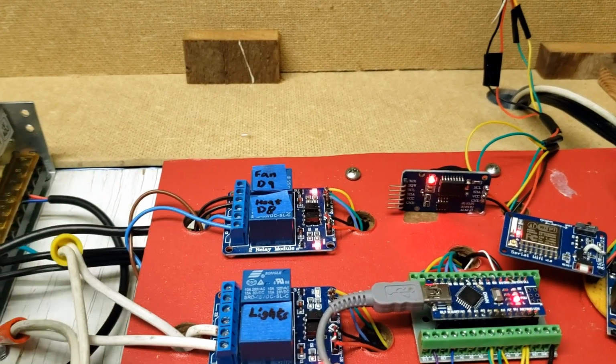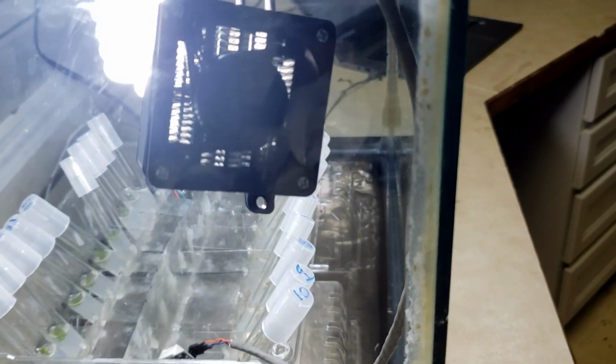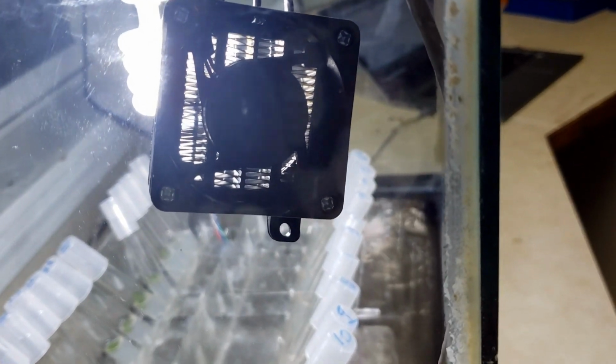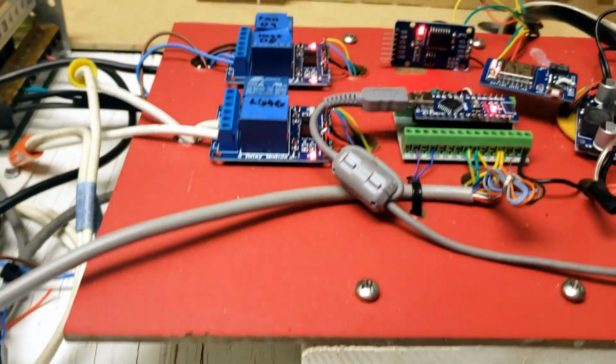And you can see the heater just turned on again. And you can actually see the fan is on, and the heater is on as well. And the heater will turn on and off. You don't notice the heater turning on and off, just the fan stays on. And that's pretty much it.